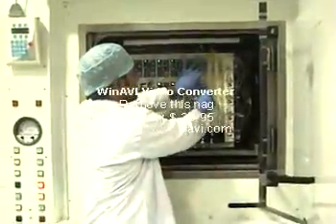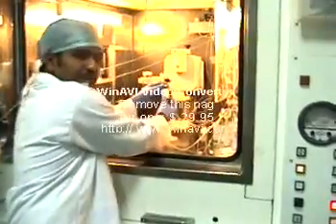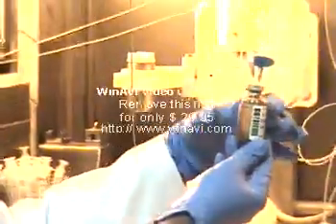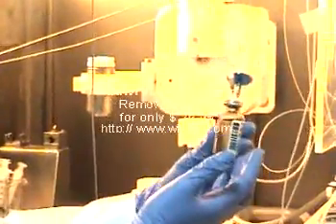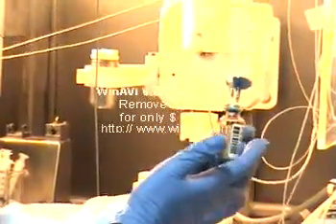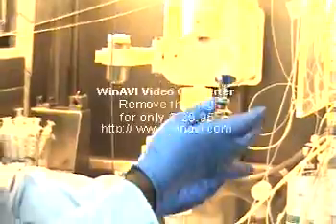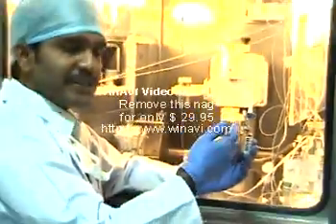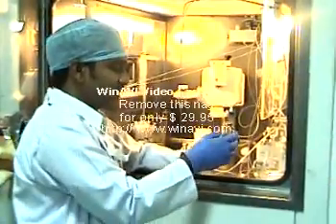Once the purification is completed, it is collected in the final vial. This is the sterile, pyrogen-free vial. We will collect the entire product in this. We take every precaution to ensure that it is sterile and pyrogen-free, because we are injecting it into patients and we must take care of that.